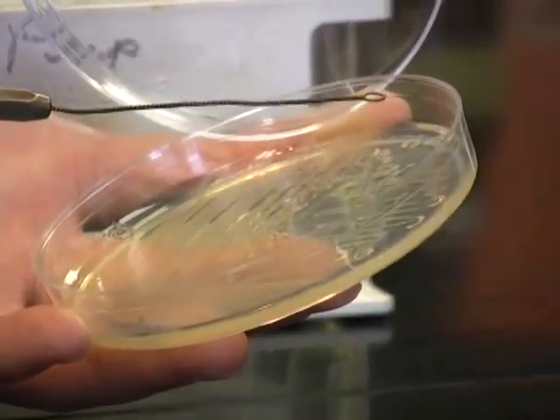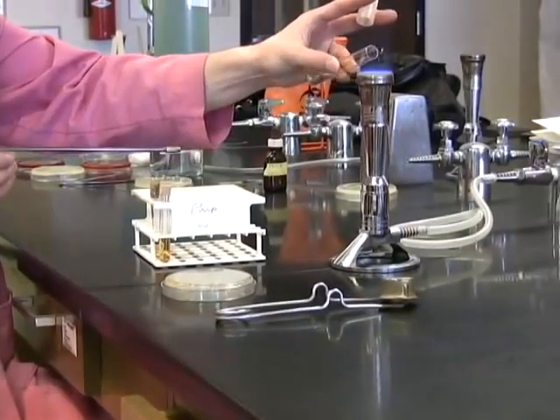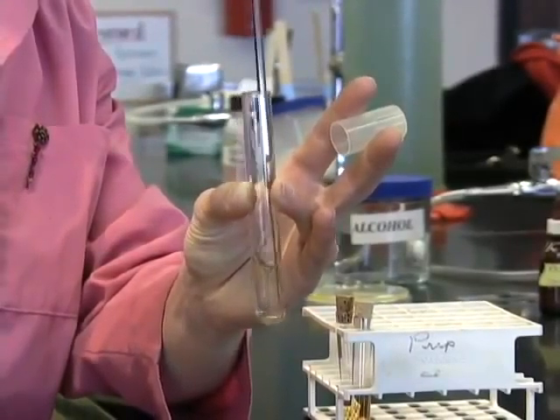Once you've gotten the appropriate inoculum, you're simply going to mix it into the tube of broth, and it generally helps to mix back and forth quite a bit to be certain that you're removing the bacterial growth from your loop and into the broth.